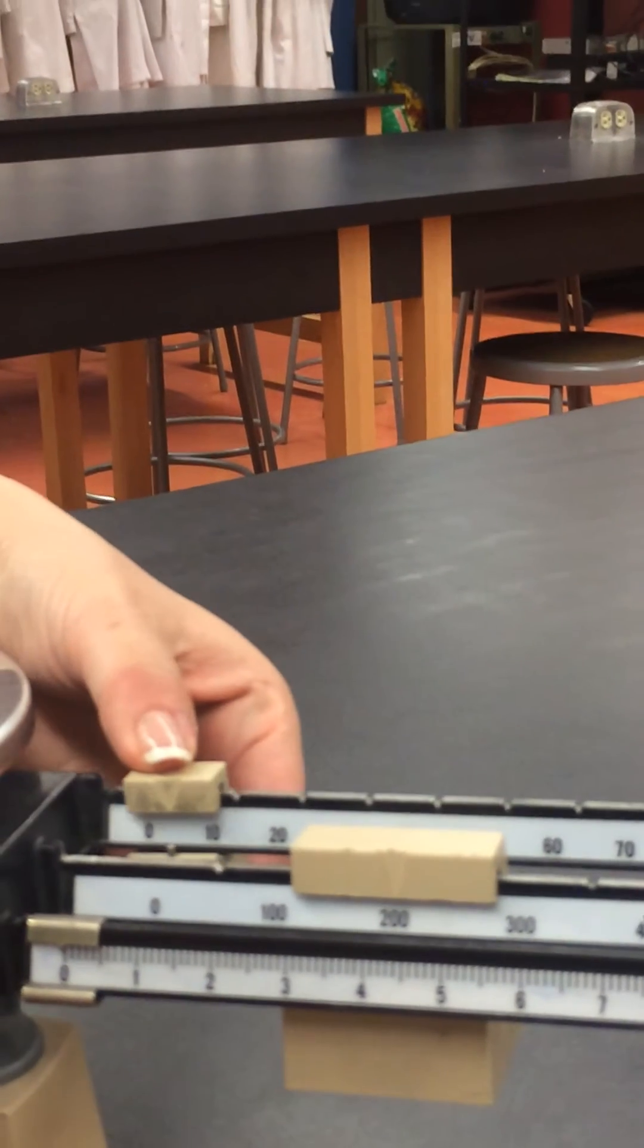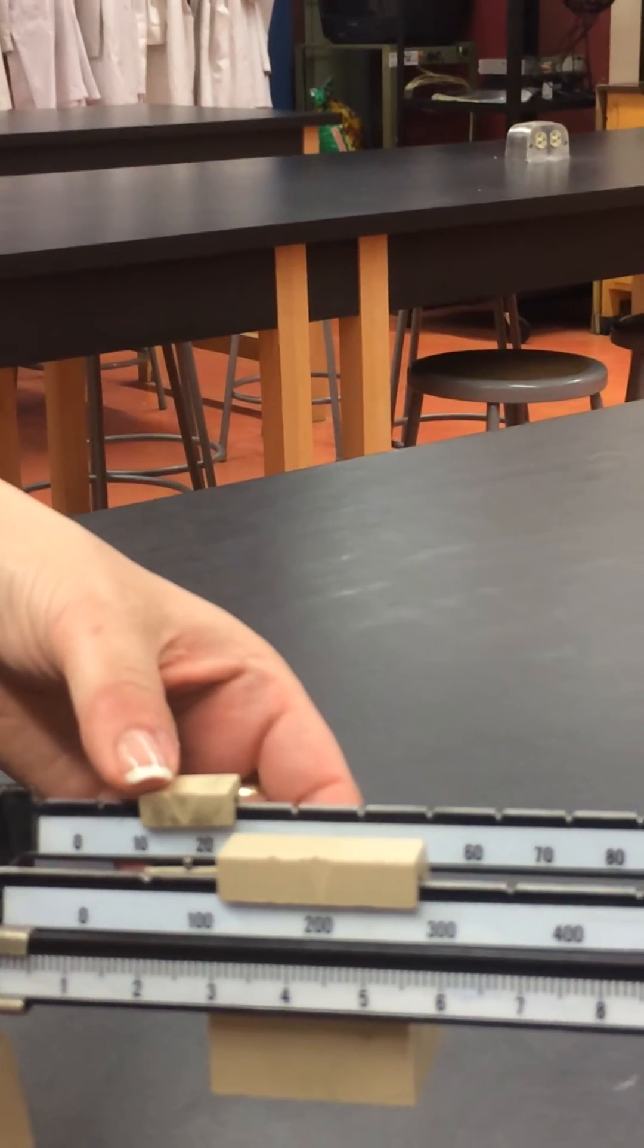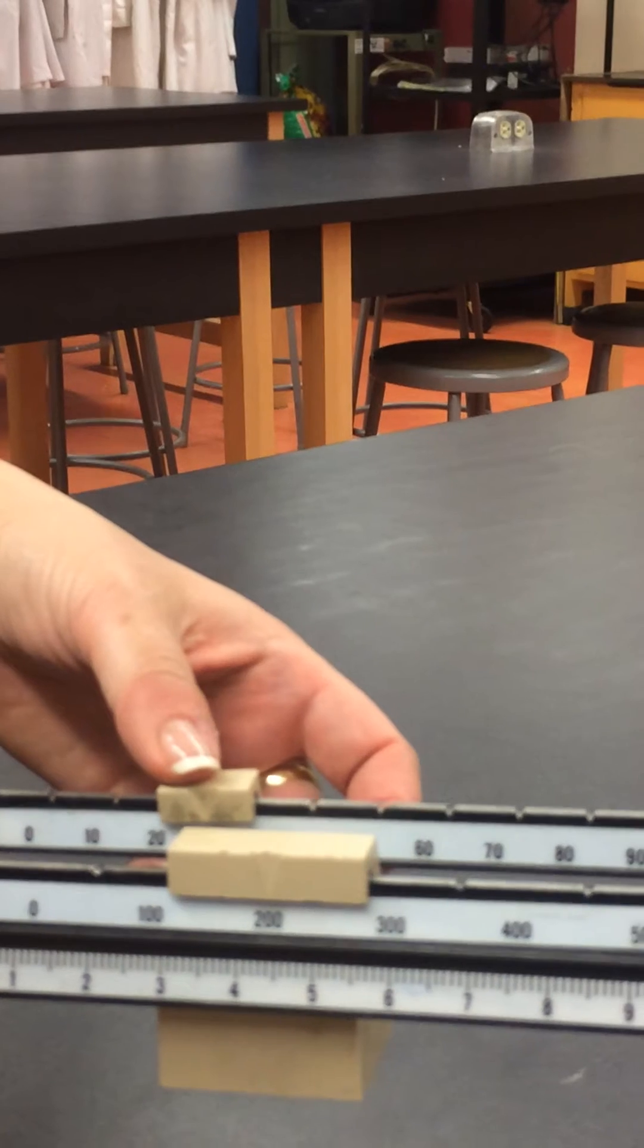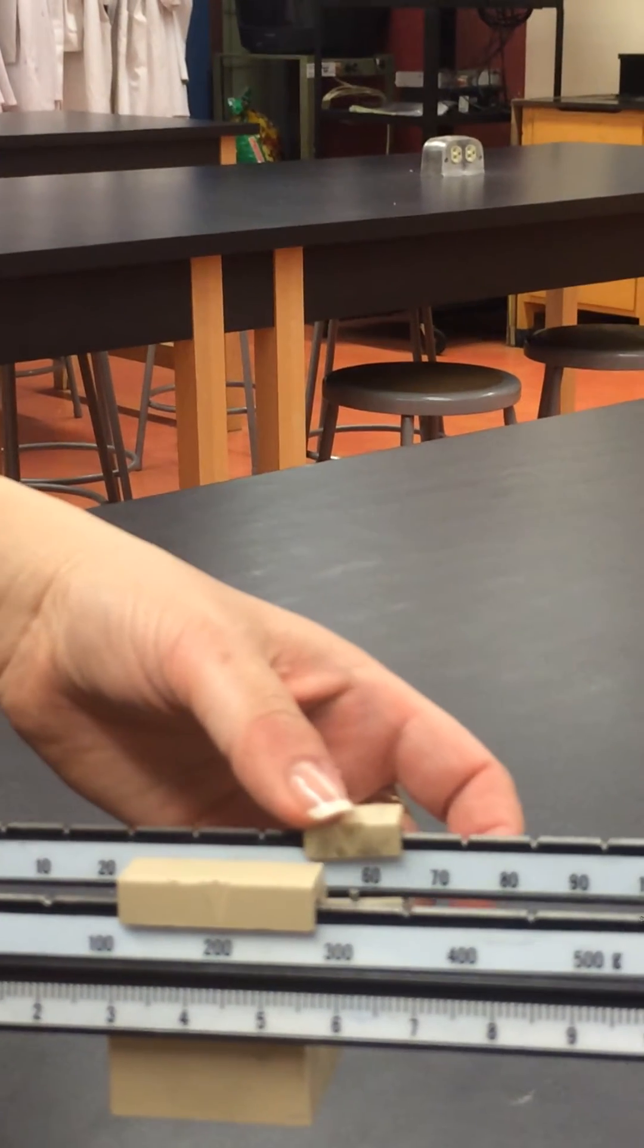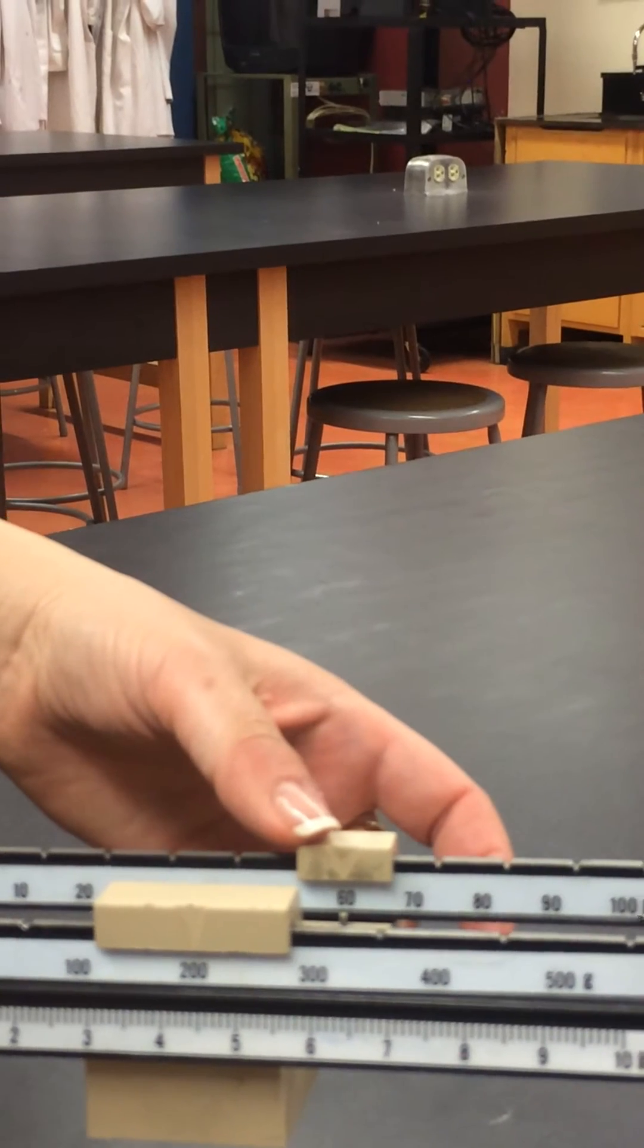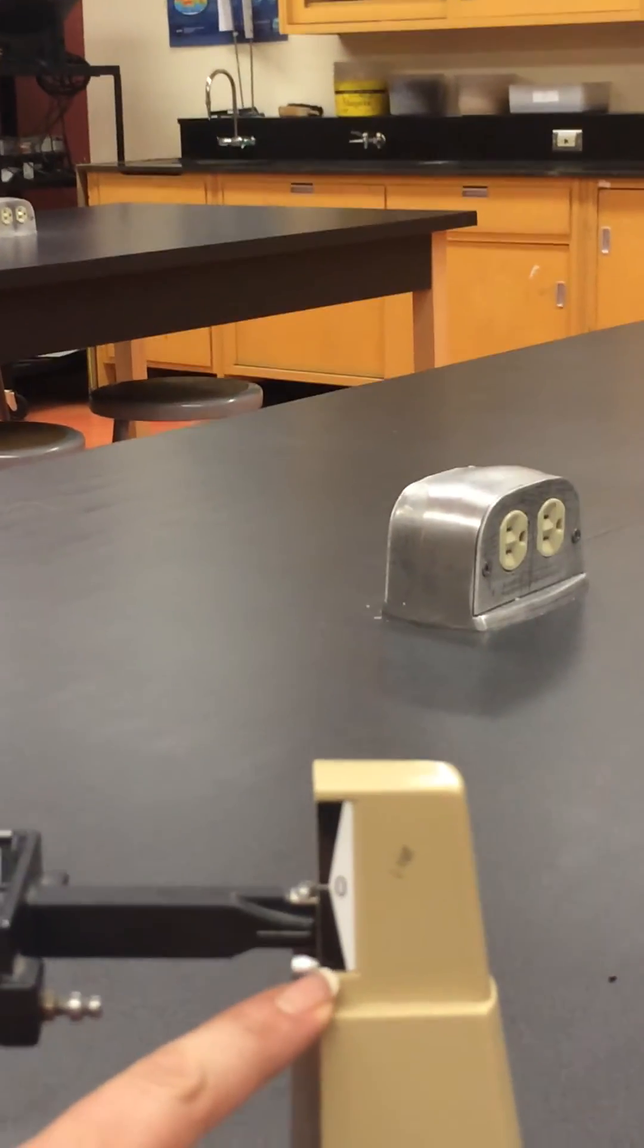Then we continue with the tens. They have to be placed carefully on top of the number. You keep going until the line goes down below zero.